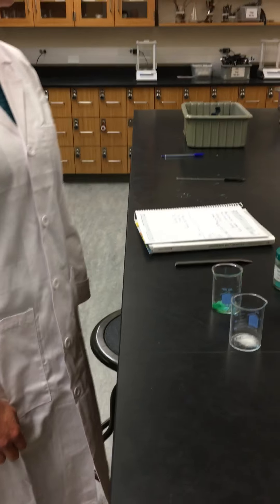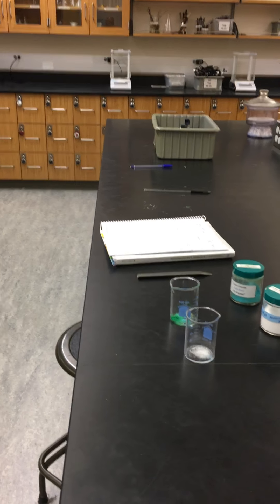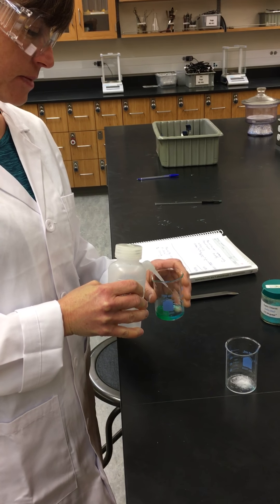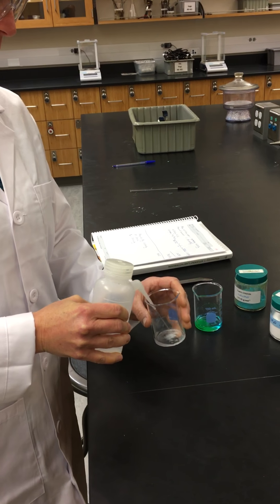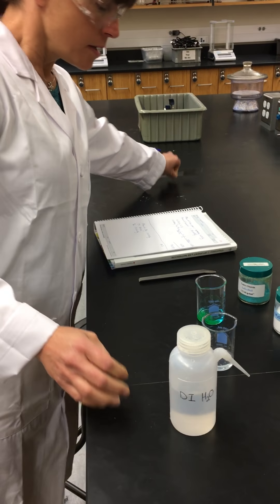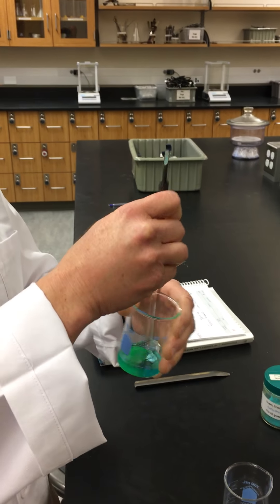The first thing we're going to do is make these into solution using deionized water. Using deionized water we're going to bring our copper chloride into solution and our sodium phosphate. Using a glass stirring rod we are going to speed up the process of having these go into solution.